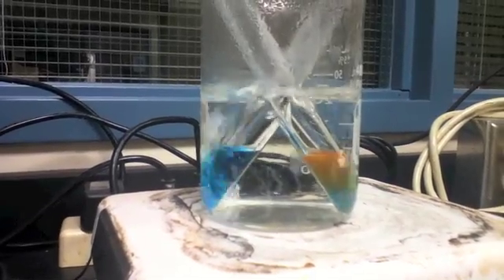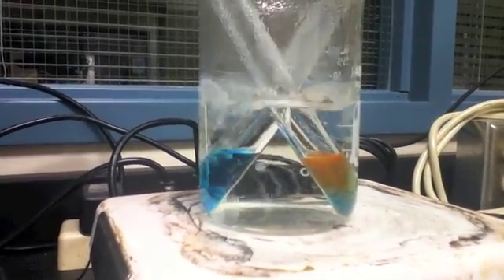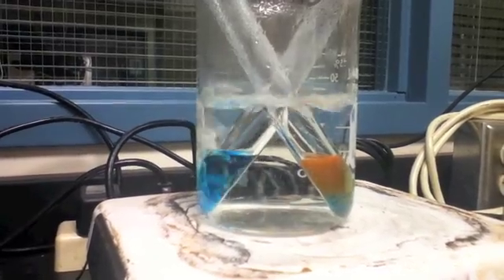I'll let these tubes remain in the boiling water for the required 3 minutes and compare the results in the next portion of this video.